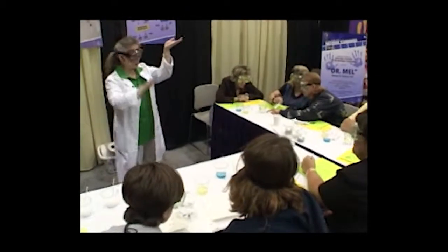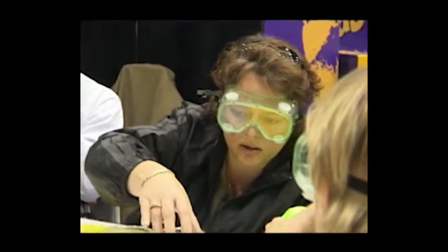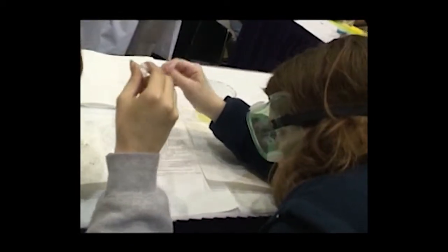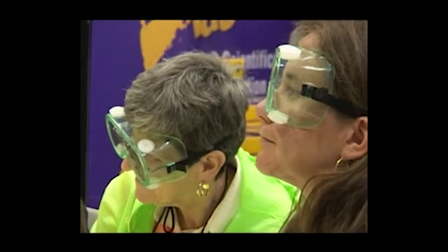Some floated, some sank. The next thing we're going to talk about is the solution that we are going to use for the plastics that are sinkers in water.